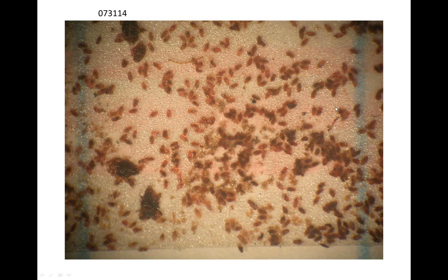Now we move to a photograph of that area, and you can see where, as you're counting several thousand on a tape, oh gosh, it takes a little bit of time, but you have a counter in one hand, and you're looking through, and you're counting like crazy. What you may have to do, and I did have to, is the area between the 2 ruled lines, I had to make additional lines on the tape so I had a smaller area to count, and then I could move to another smaller area and count, as we had this many on the tape.